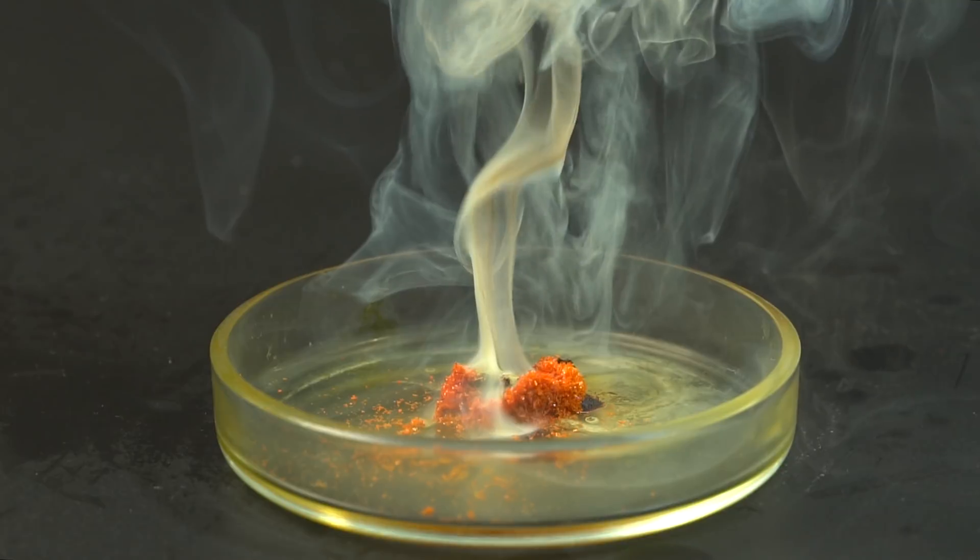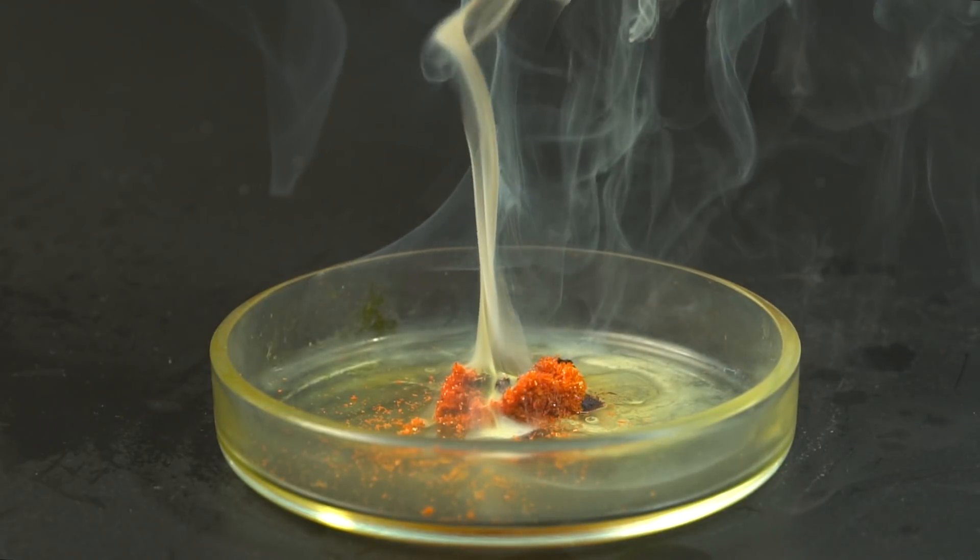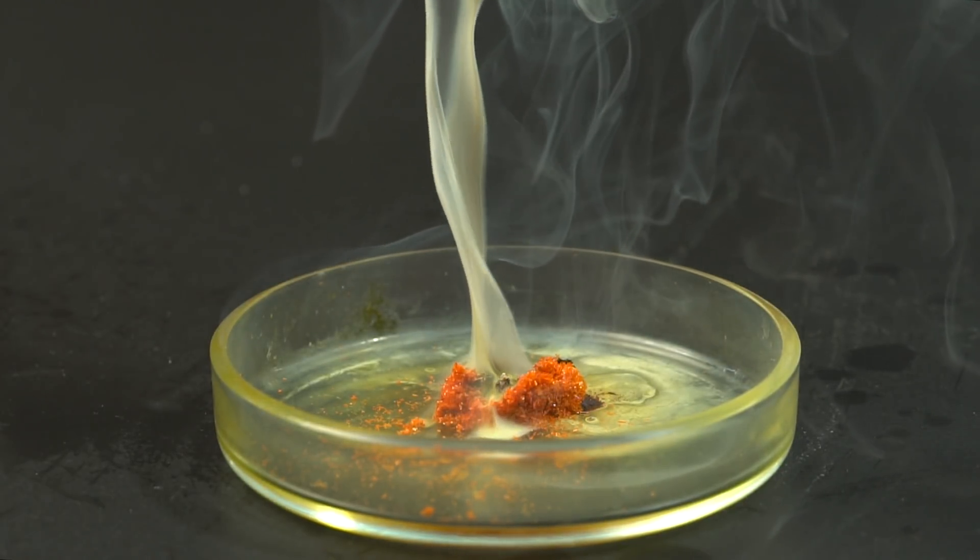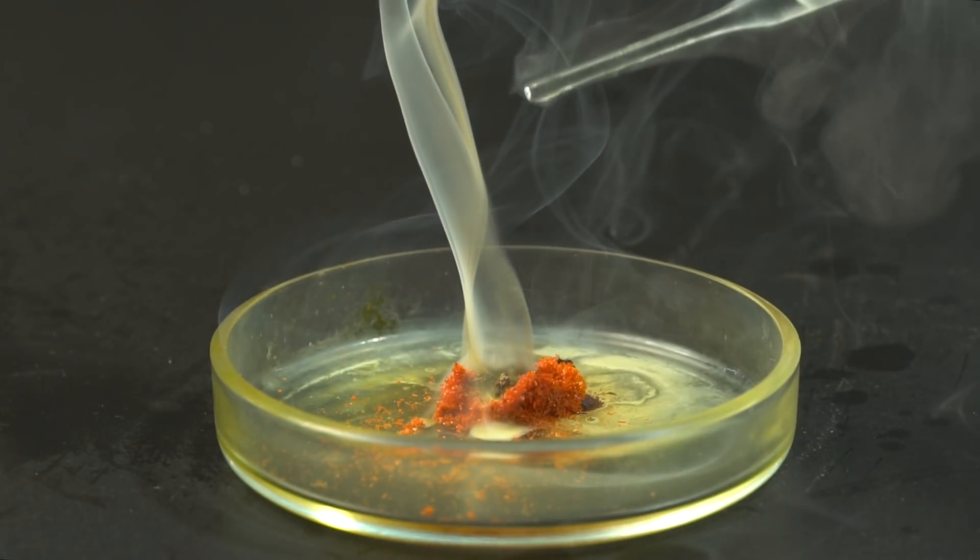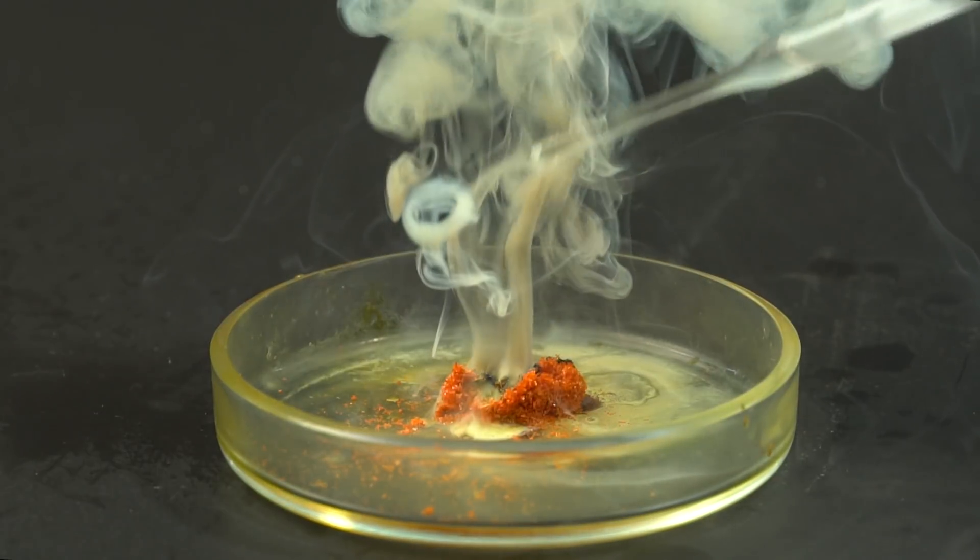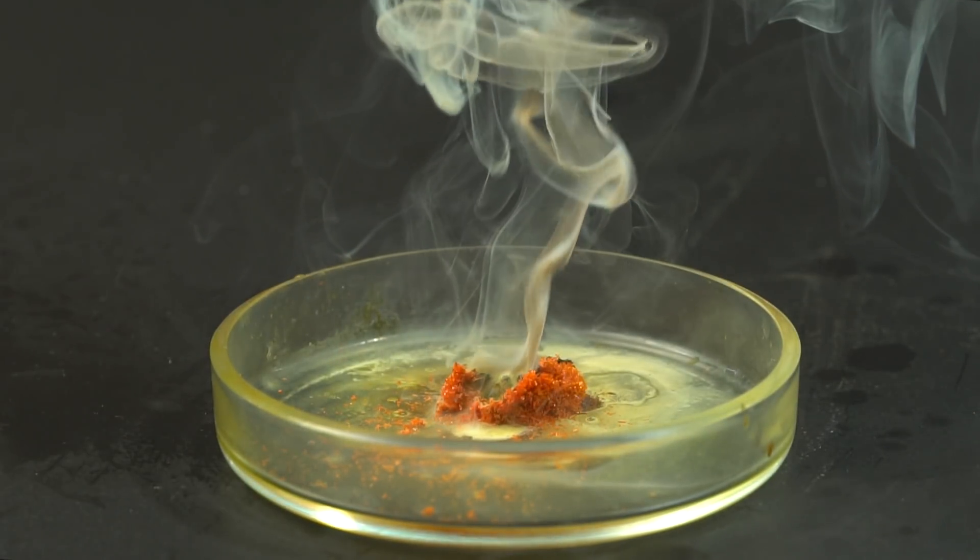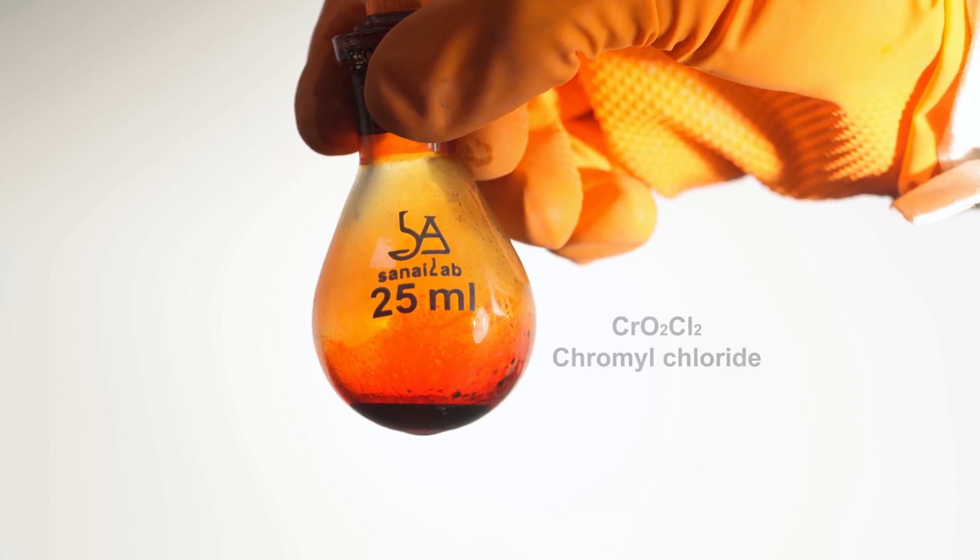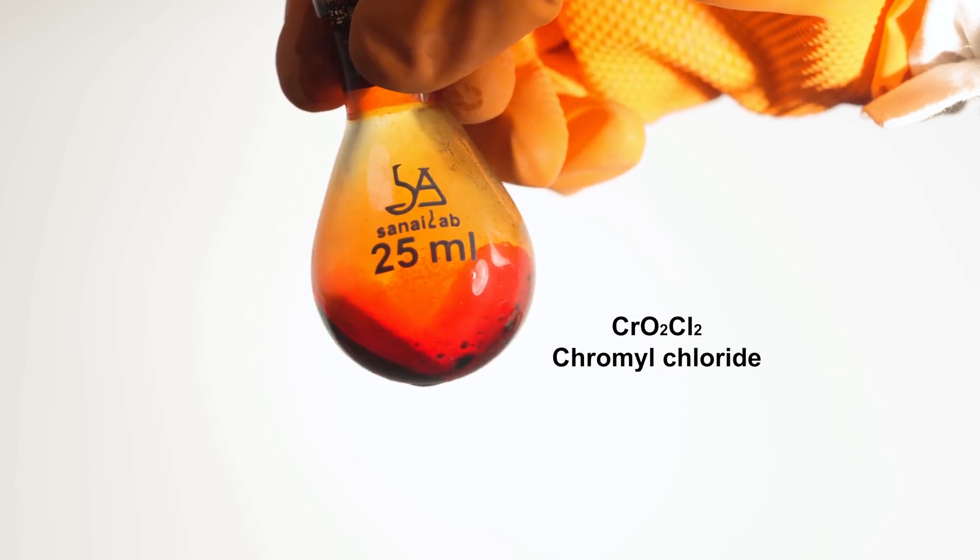So I decided to experiment with pure chromyl chloride a little bit, since there still were some reagents besides chromyl chloride that could affect this reaction, such as chromium trioxide, oleum, and unreacted potassium chlorochromate. So I prepared a few milliliters of fresh and pure chromyl chloride.